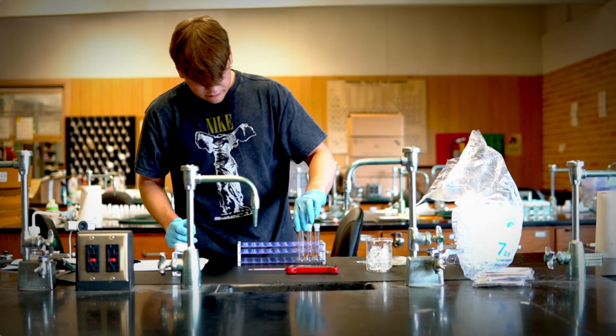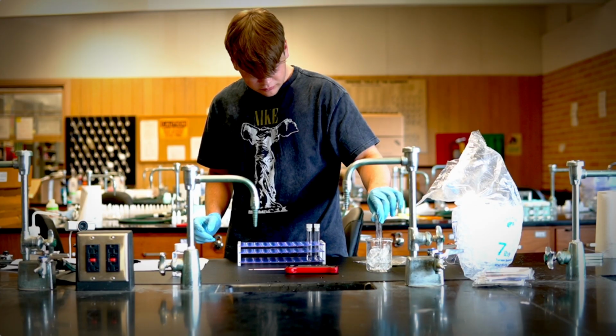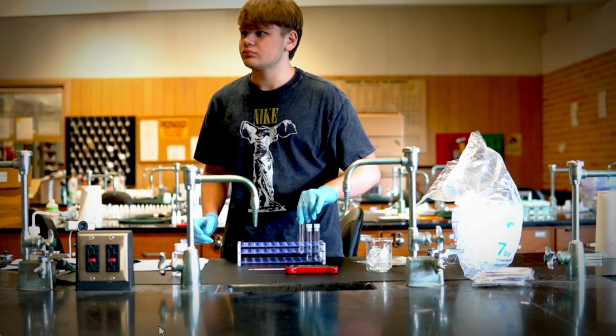Then make sure that you have everything to go. Make sure that you have your thermometer and your ice. You can add a little bit of water into the ice to make it ice water, so that your tube will be able to fit, but make sure that you add the same amount of water in all experiments, just a tiny bit. But before you get started, let's go back to the table so that you can understand what we're doing today.